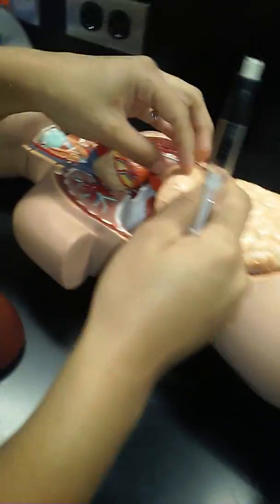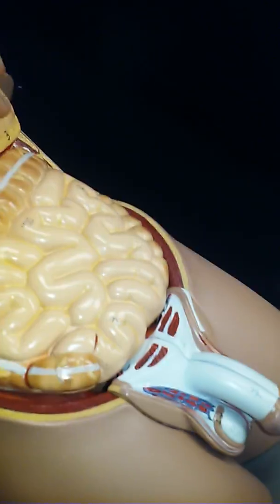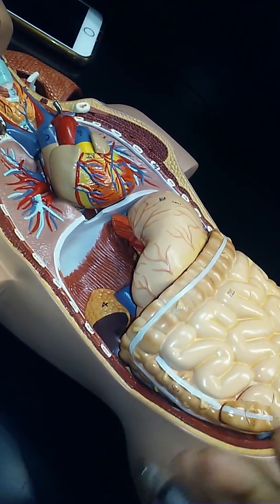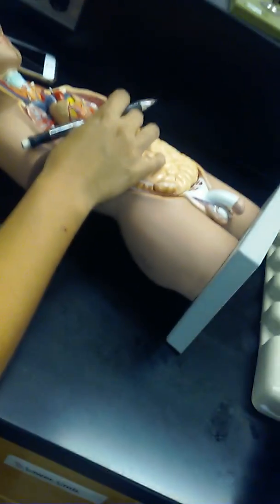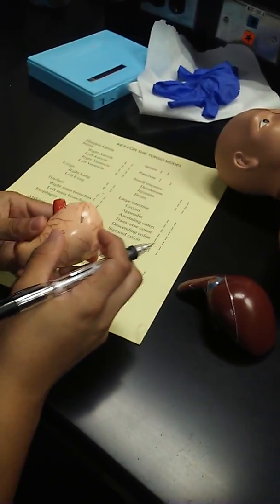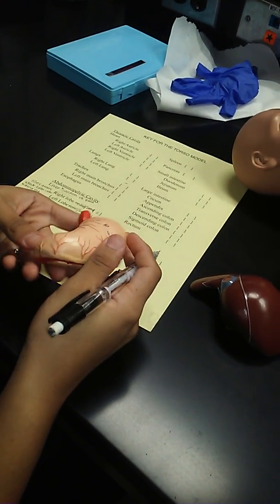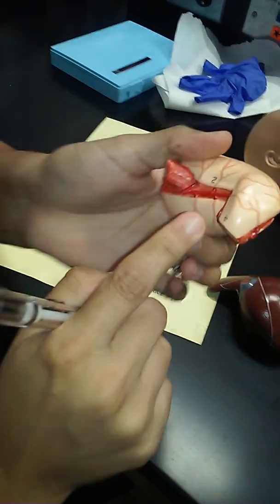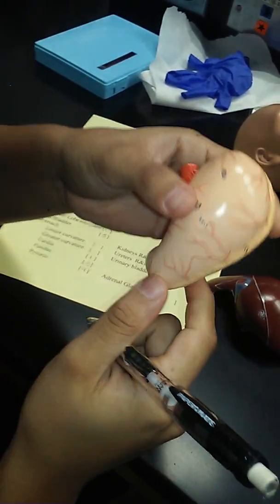As the food gets over here to leaving, the stomach gets narrower and narrower, so it can squeeze harder and harder. Okay. You've got to liquefy that food if you're going to digest it properly. This narrow part is called the pylorus of the stomach. So cardia, fundus, pylorus are the 3 main areas of the stomach.